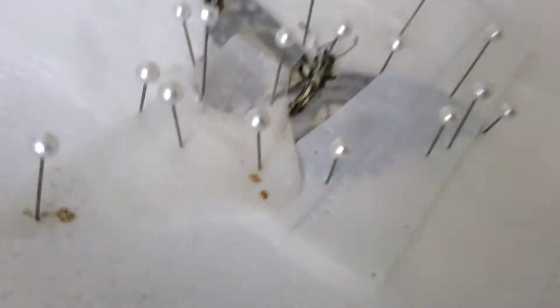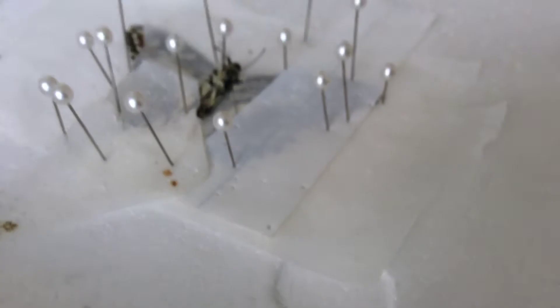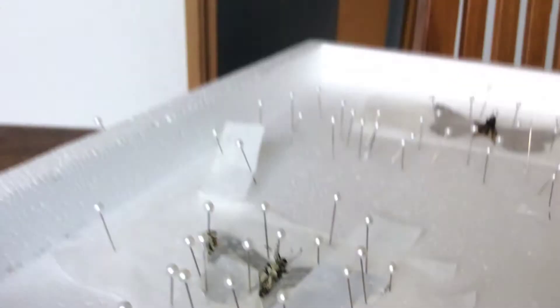Now, how I got this butterfly to this state is out of my relaxation chamber — if you don't know what that is, check out our first video. It's untitled because my cameraman with the editing forgot to add a title. So you're going to rehydrate your butterfly, which is just moistening up damp cloths and then putting your butterfly in there, adding the butterfly in the moistened rehydration chamber into the fridge for a few days until it's well movable with your hands. Once that's done, you can begin mounting. The first needle here was done through the thorax.